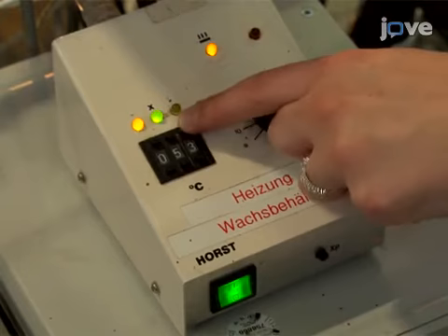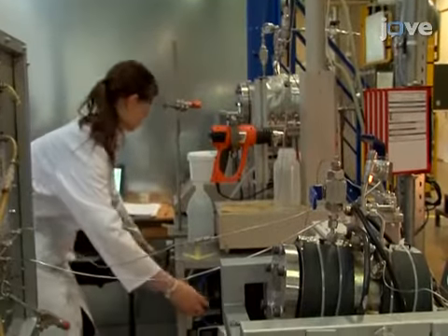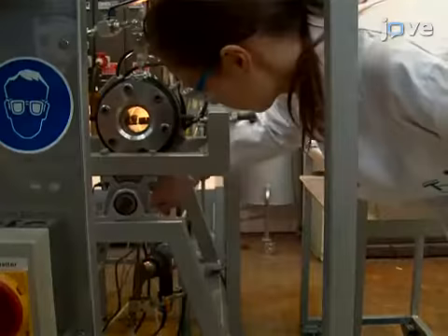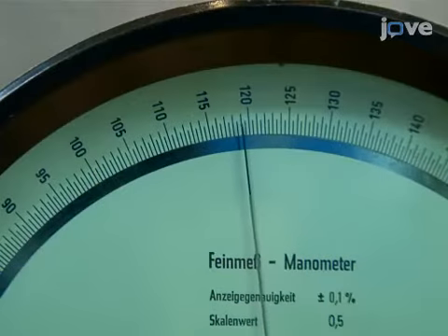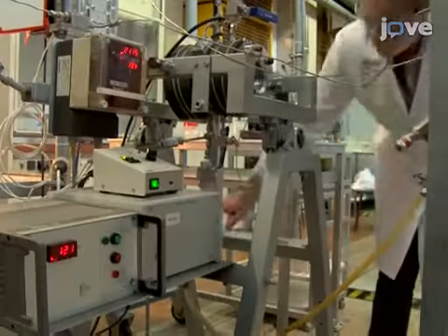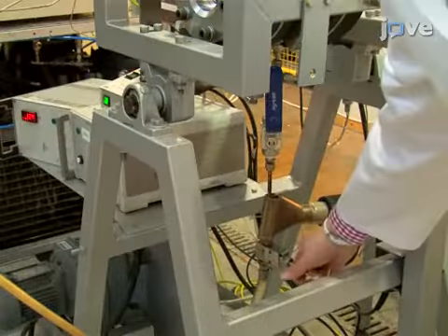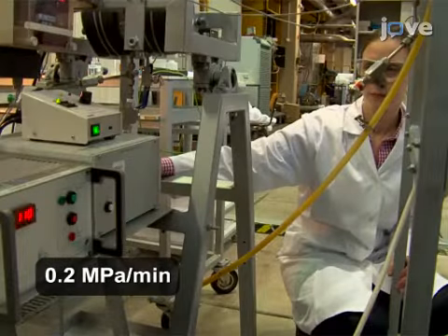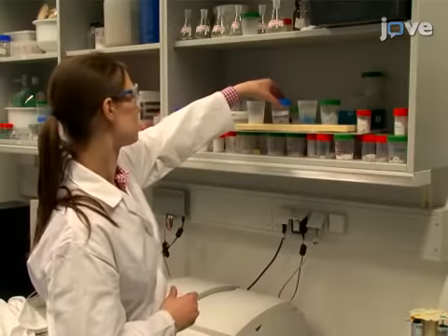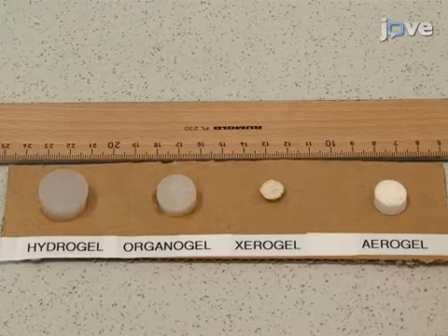Now, heat the autoclave to 323 Kelvin and apply 12 megapascal of pressure using carbon dioxide. Periodically, replace the carbon dioxide inside the autoclave while keeping the pressure constant. Around 6 or 7 residence volumes are typically required. The drying time depends on the gel thickness. As before, slowly depressurize the autoclave. Then, store the prepared aerogels in a sealed container or a desiccator. These aerogels are sensitive to moisture in the atmosphere.